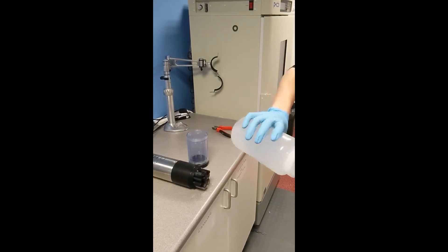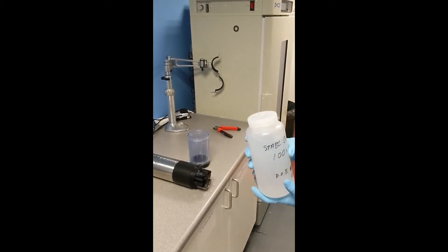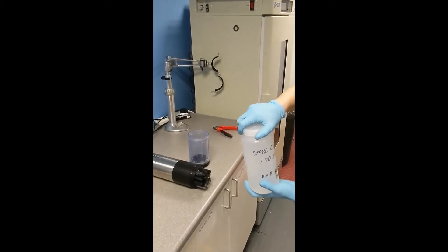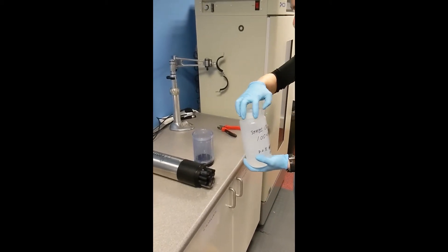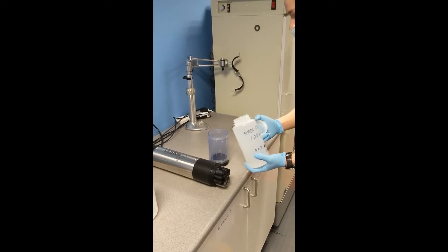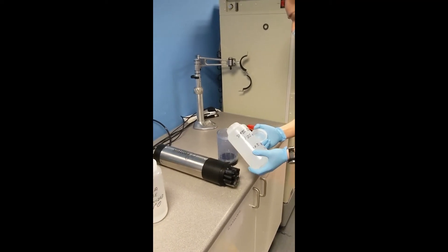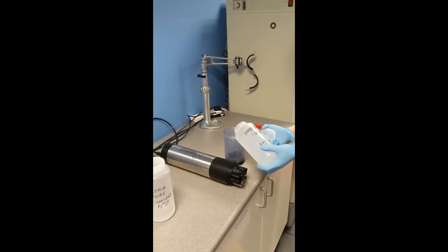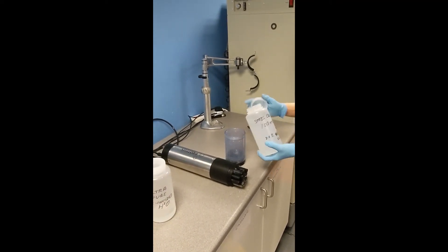Invert it gently, don't shake it, otherwise you will introduce air bubbles and that can also interfere with the signal. And then again, we need to rinse it first in the fluid that we're going to use.